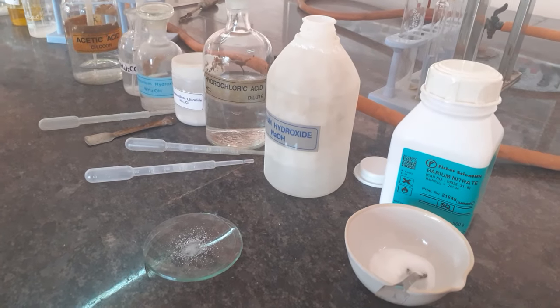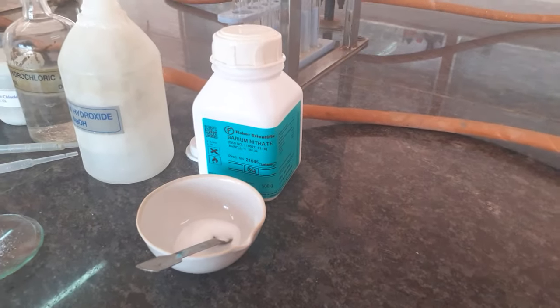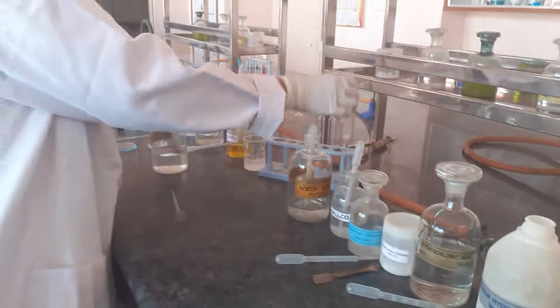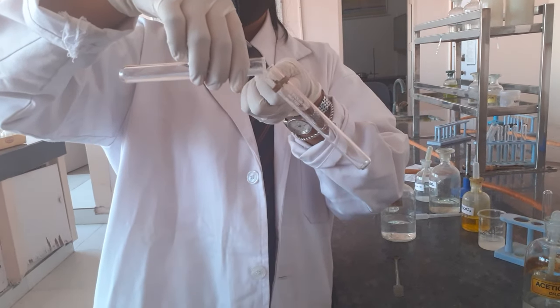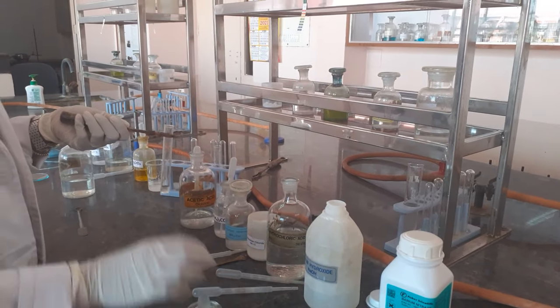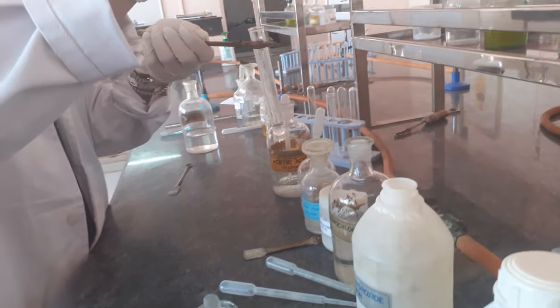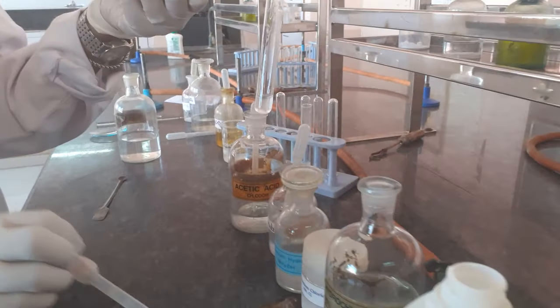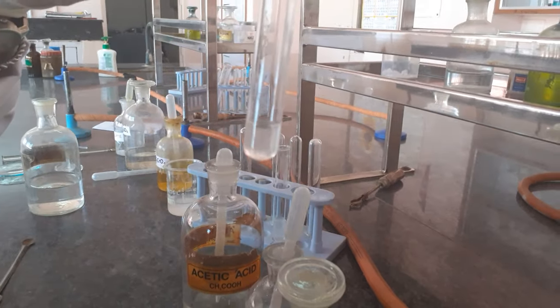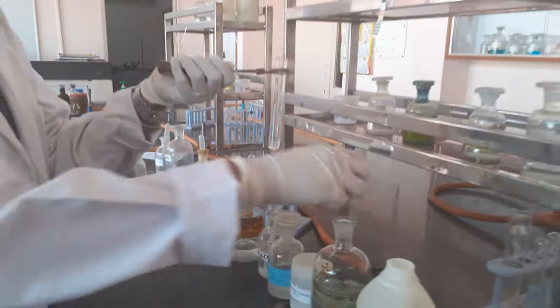Now proceed for group 1, which requires the original solution — OS — which is simply salt dissolved in water. Take around 1 ml of OS and add dilute HCl for group 1 cations. As you can see, there is no precipitate formed, showing that group 1 is absent, which means the salt does not contain lead ions.